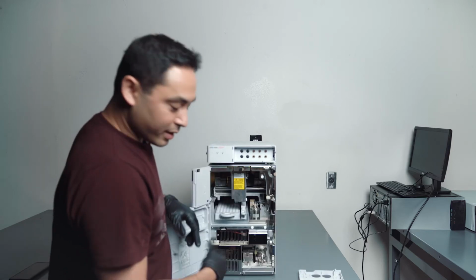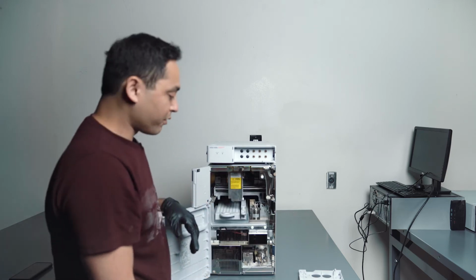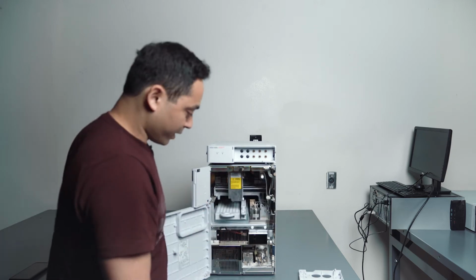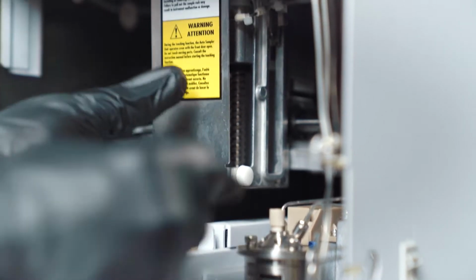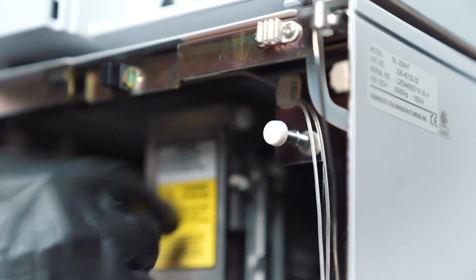When the instrument is off, you can move this guy. You can either power the instrument off, which I think is the best way to change it. There's gonna be 3 thumb screws. You want to unscrew this one, one up here, and one over here. You don't need to take them all the way off. You just need to loosen them enough that this guy comes off.